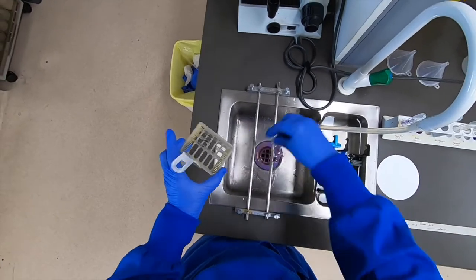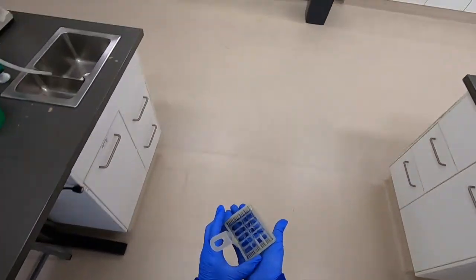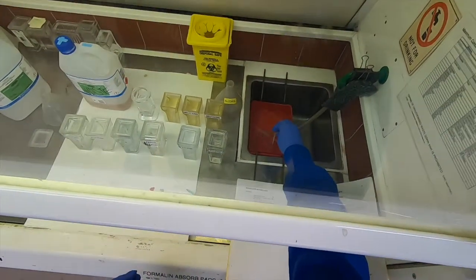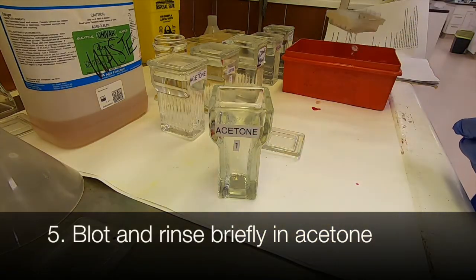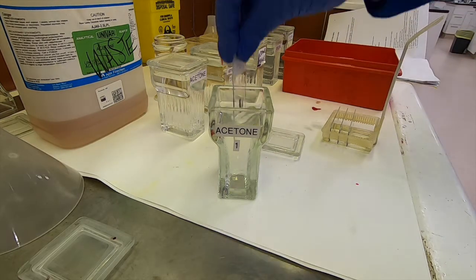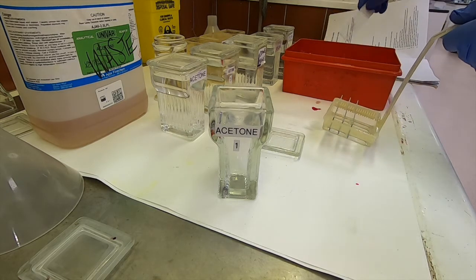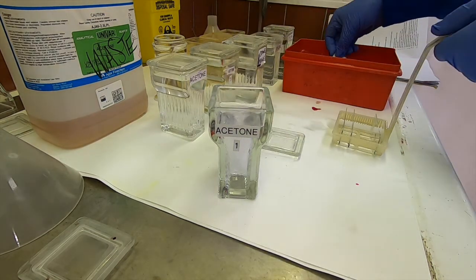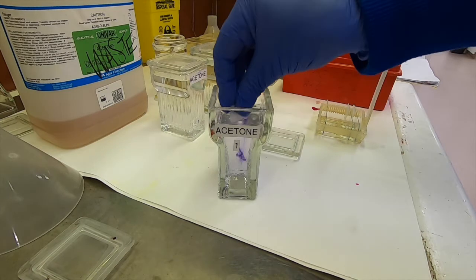Now to continue, we need to differentiate or decolorise the complex, and we'll do that over in the fume cupboard. I'll just put those into the water bath there. I would normally employ a blotting step in between this technique, as I think I get better results that way, but here I'll just flick off the water. It's a brief dip in the acetone — no more than two to three dips — and then promptly back into the water bath. You can see it's on that second or third dip that the majority of the excess dye will be released, and that's all that is needed on this occasion.